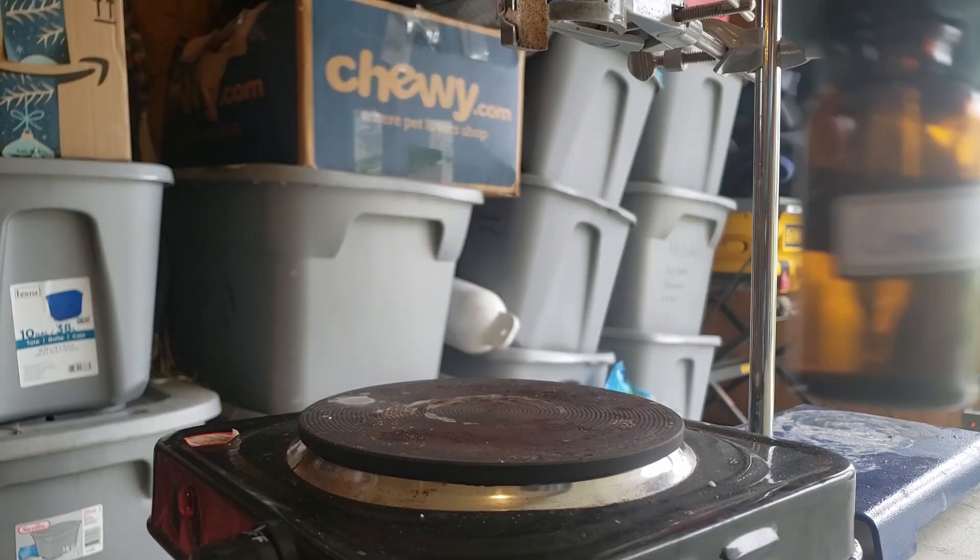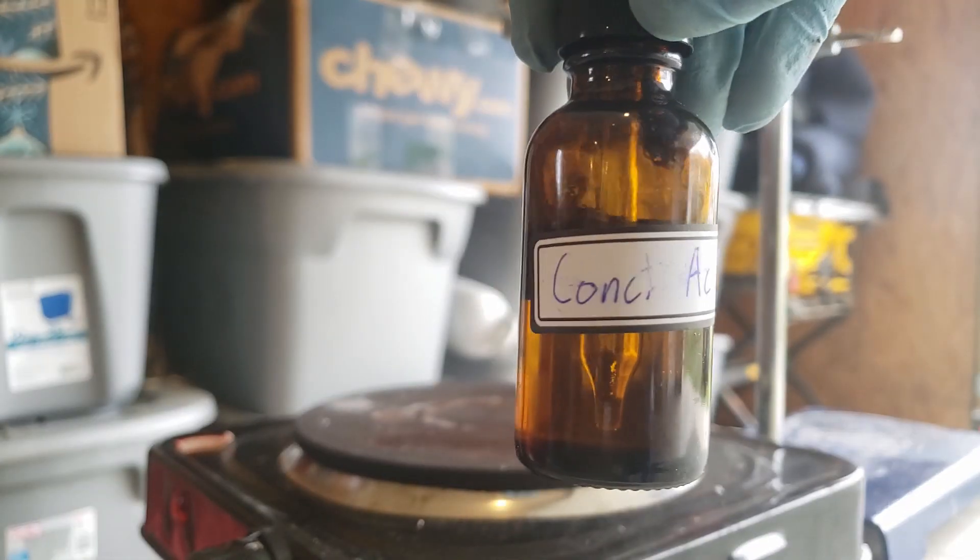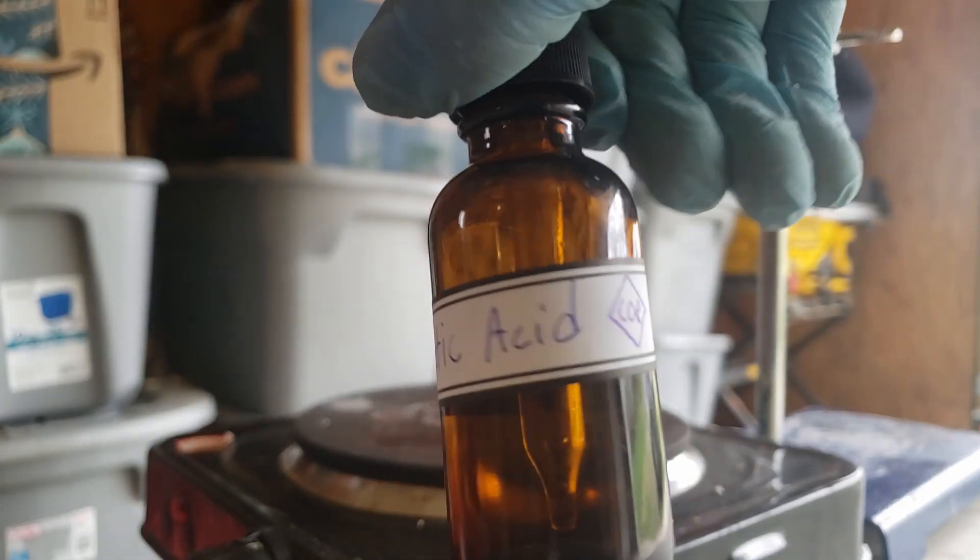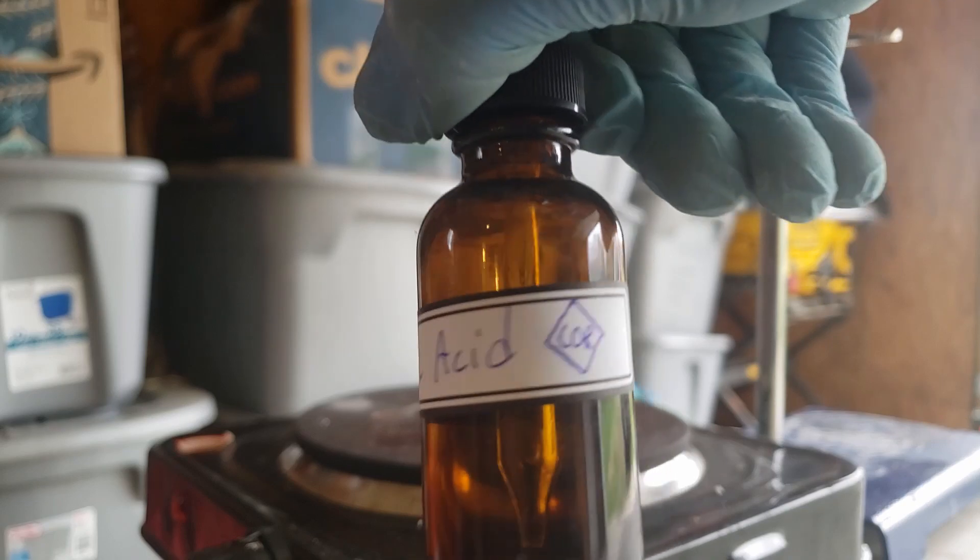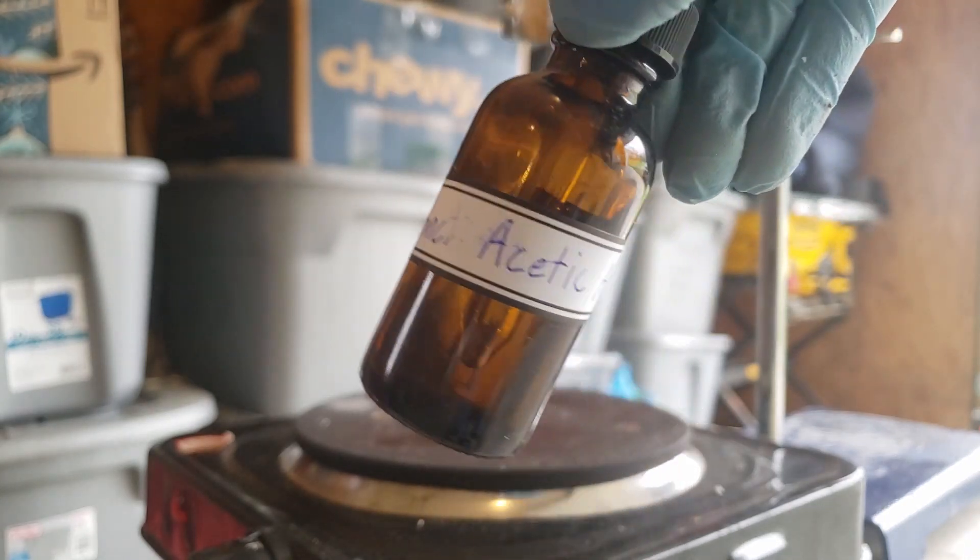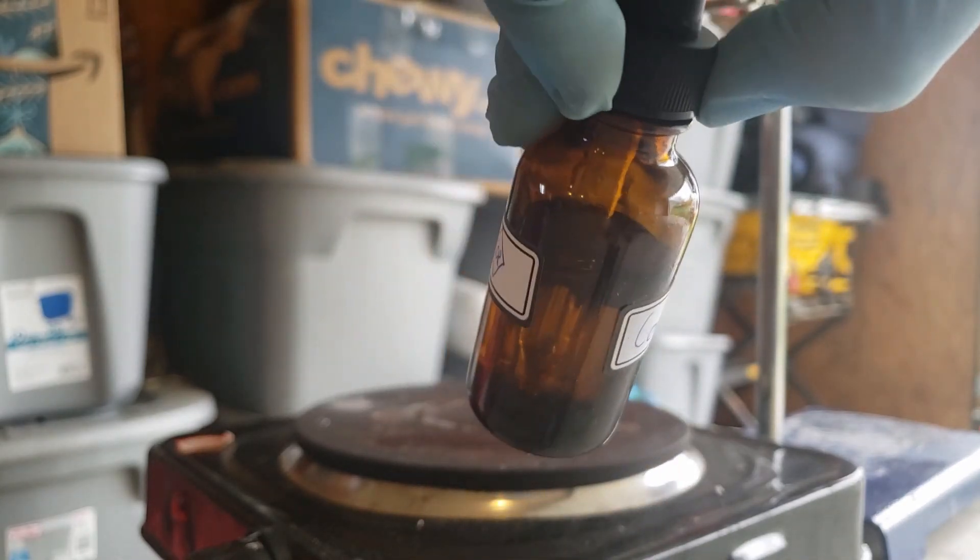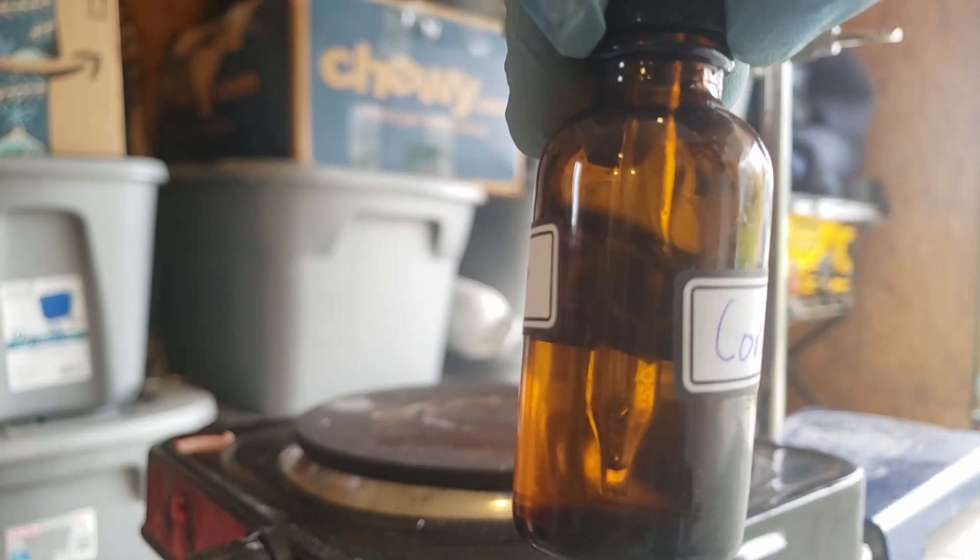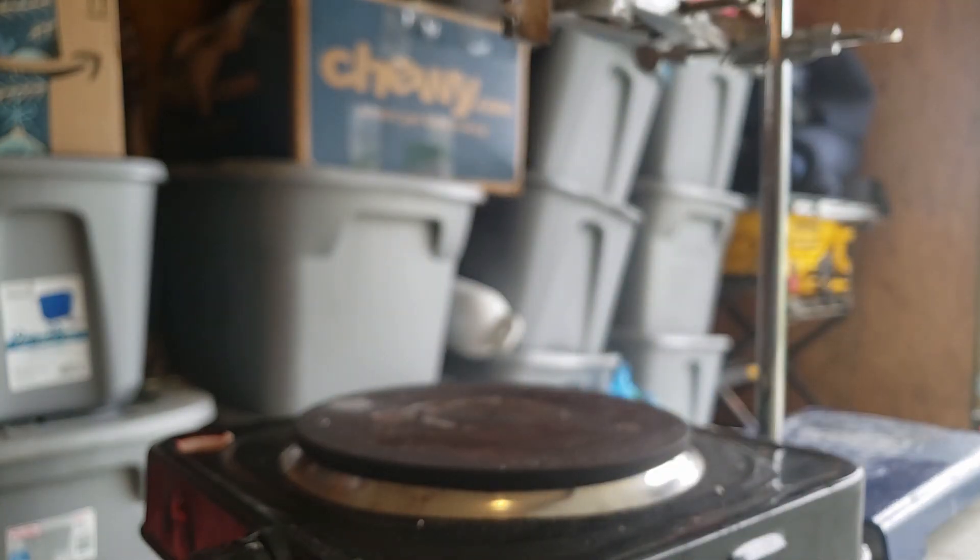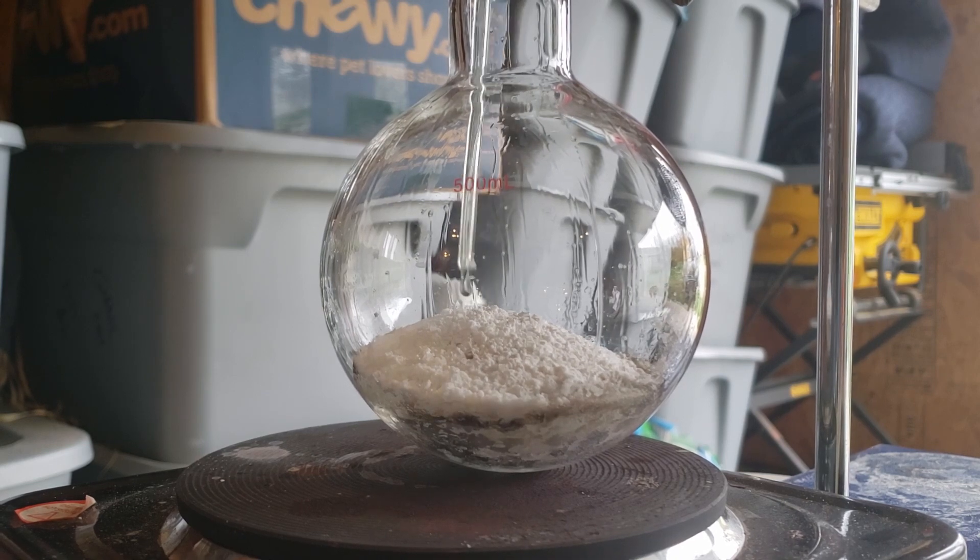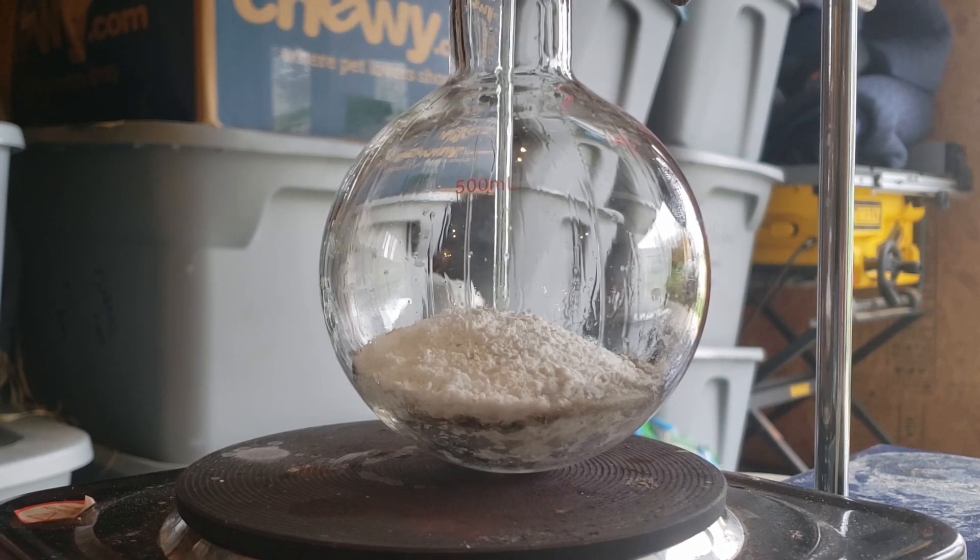In the end, I got about 50ml of highly concentrated acetic acid. This acetic acid is likely near glacial because when I add it to a test tube with some sodium carbonate, it doesn't really react very much, which is indicative of very concentrated acid.